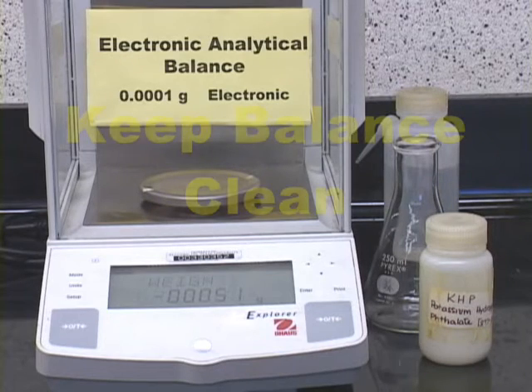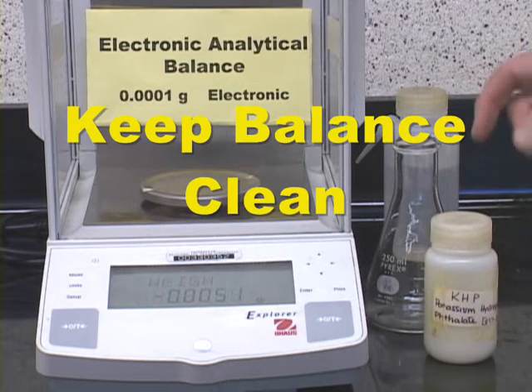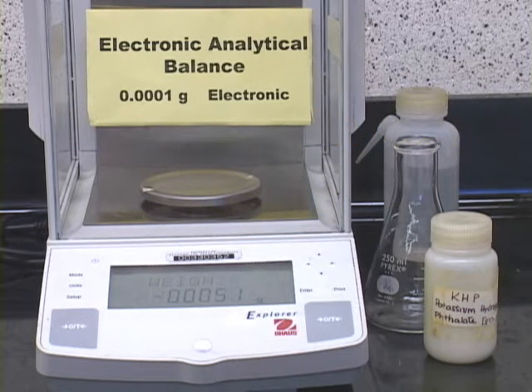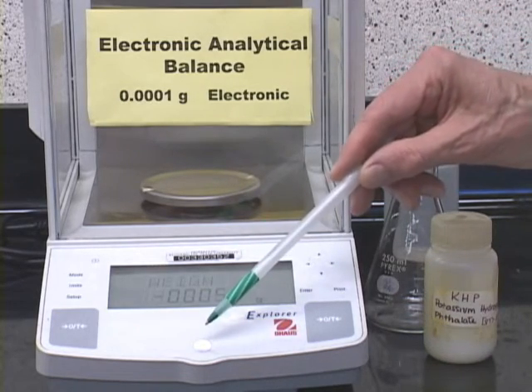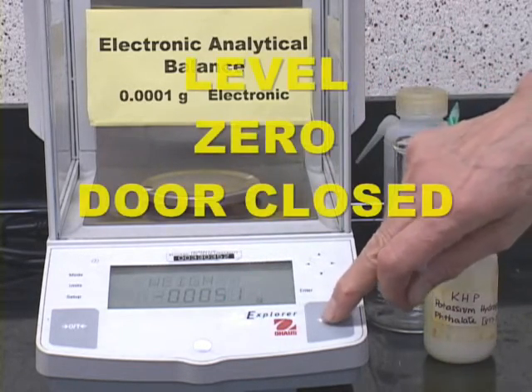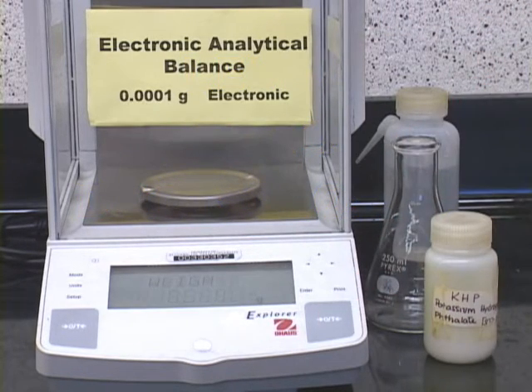We'll start by weighing and titrating the standard. That's the KHP, and to do that we'll use an electronic analytical balance. This is an ideal balance to use because the weighing error with proper technique should be less than 0.1%. Now make sure that the balance is level. Make sure that it reads 0 with all the doors closed here, and then you can weigh the empty flask.